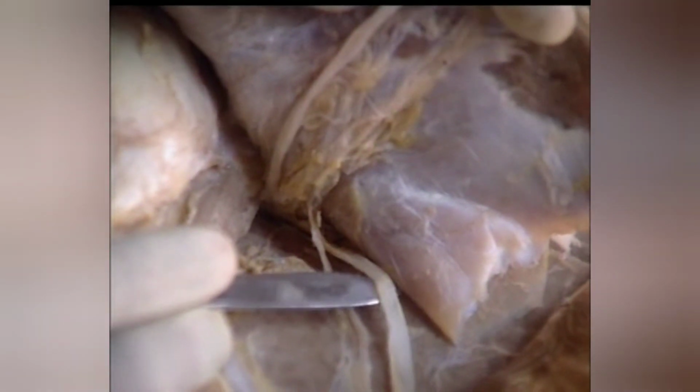After supplying these muscles, this nerve continues down as the lateral cutaneous nerve of the forearm. It runs below the scapular head of deltoideus and supplies the skin on the lateral aspect of the forearm. This is the posterior circumflex artery supplying the deltoideus and teres minor.